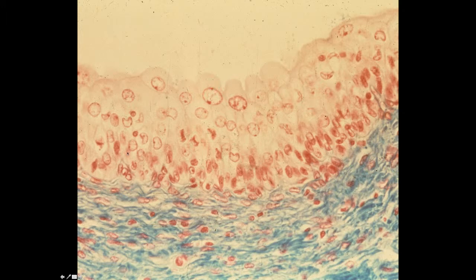It's a stratified epithelium, but we call it a transitional epithelium because this epithelium has the ability to change its shape. It can be very much stratified like this. I don't have a view to show you, but if the bladder, for example, is very distended, this epithelium can spread out to almost look like a simple squamous epithelium. So a transitional epithelium can change its shape depending on the physiologic state of the organ, with the characteristic dome-shaped cells.